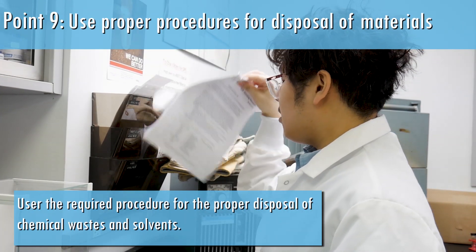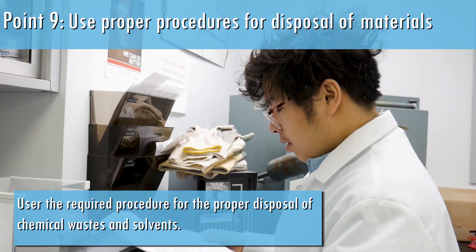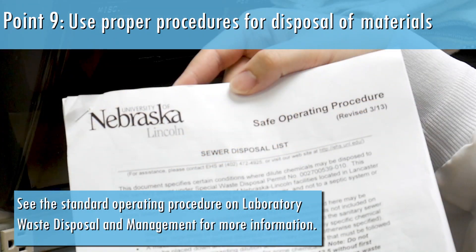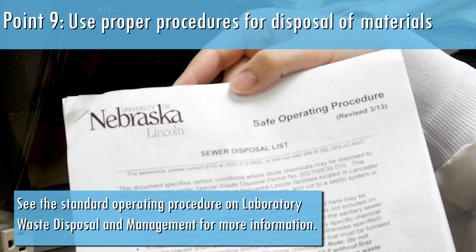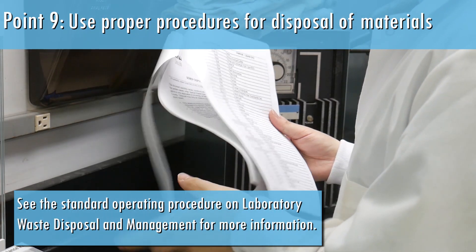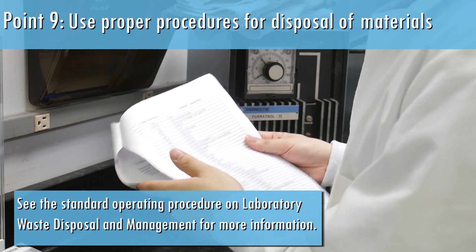Use the required procedure for the proper disposal of chemical waste and solvents. See the standard operating procedure on laboratory waste disposal and management for more information.